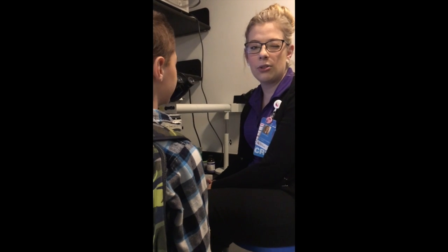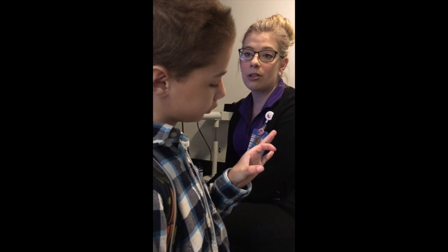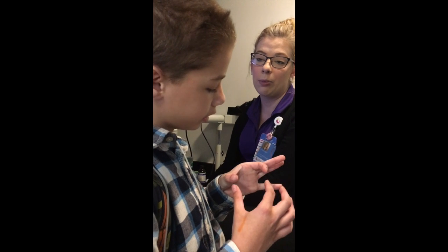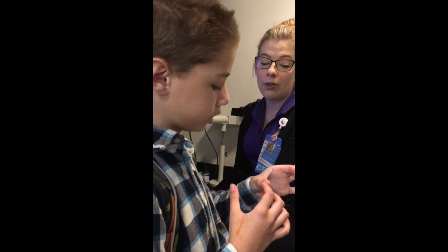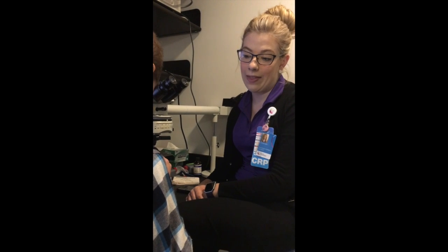Her scope is, I think, 1 or 2 millimeters bigger than mine. She and I will have off counts because that's how small these cells are. So just looking at the field in here will have a little bit of a difference. And it's good to know that so that you're not comparing and saying, well, you're wrong and I'm right. It's, oh, well, you have a different scope than I do. If you're off by a lot, then that's a different story. But if you're off by one or two.